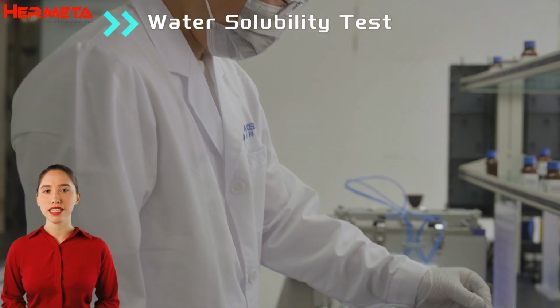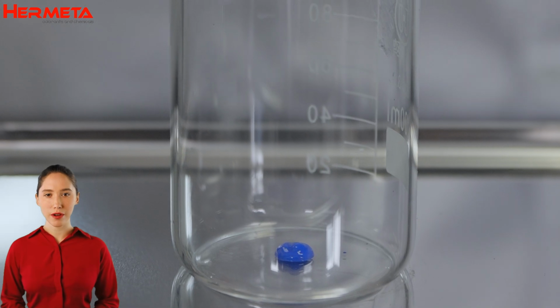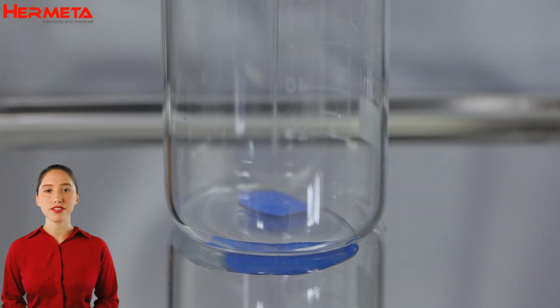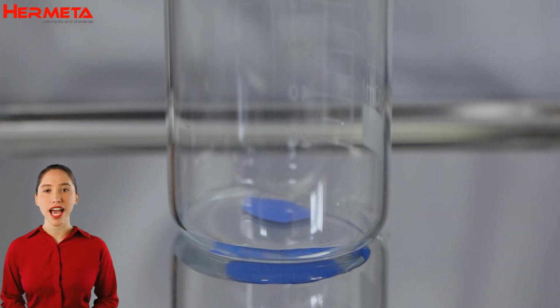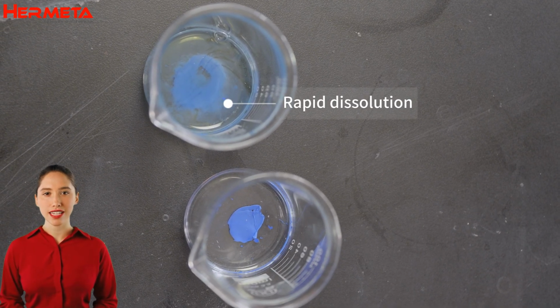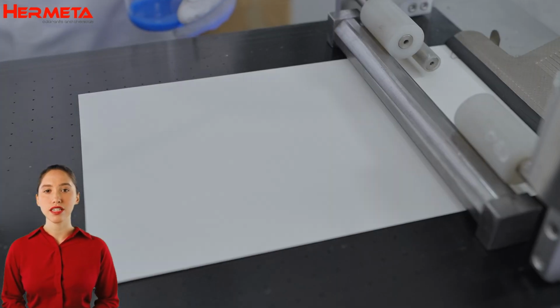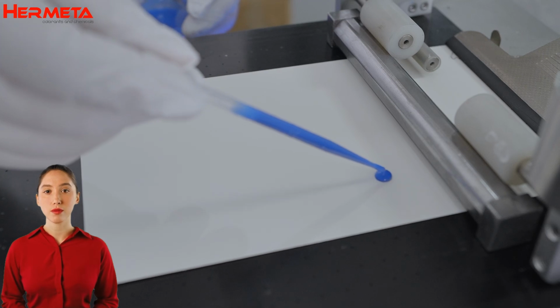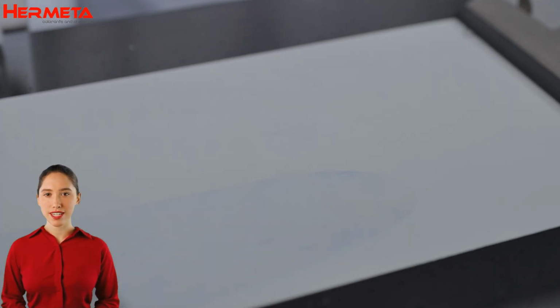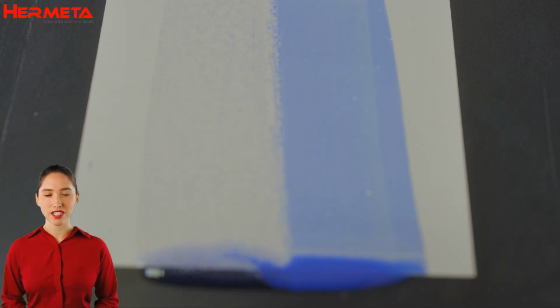The water solubility test is a key step in our process of testing the solubility of pigment powders in water. We will sample different types of organic pigment powders, add an appropriate amount of water, and observe their dissolution. Through data logging, we will analyze the dissolution rate and solubility of each pigment to assess its potential for use in waterborne coatings. Through this experiment, we can ensure that the pigments will perform as desired in various applications.